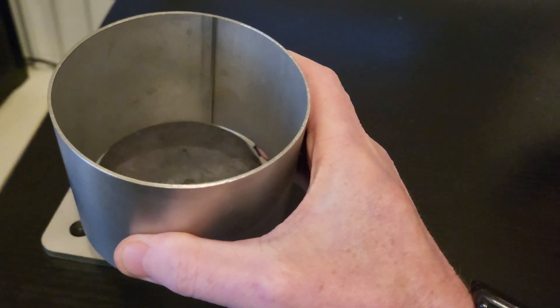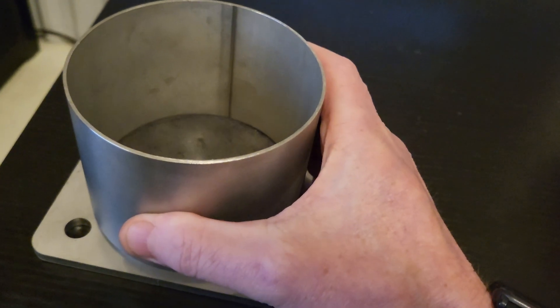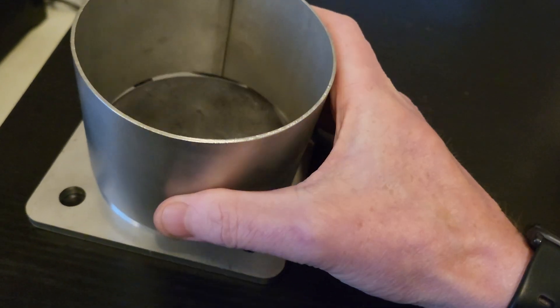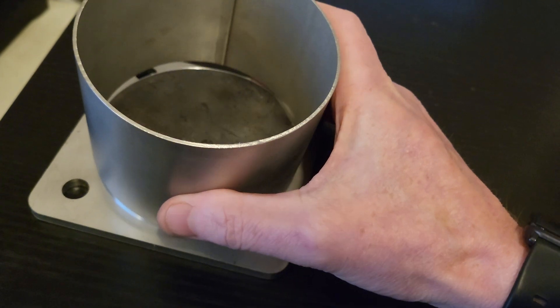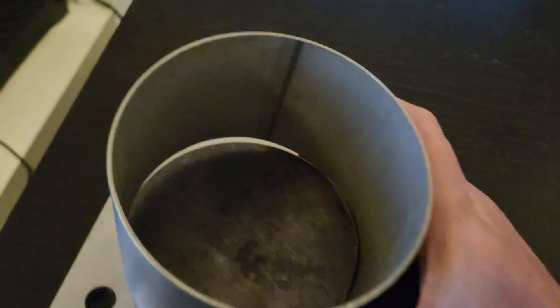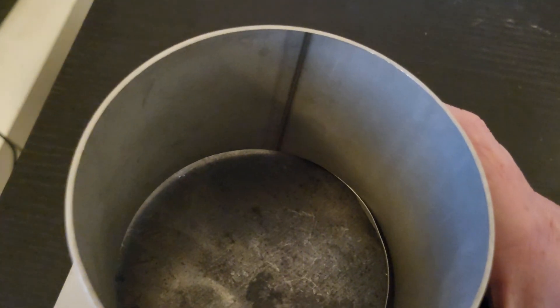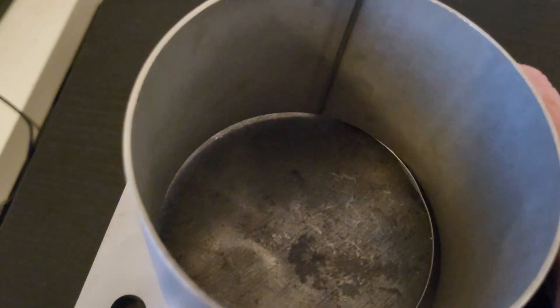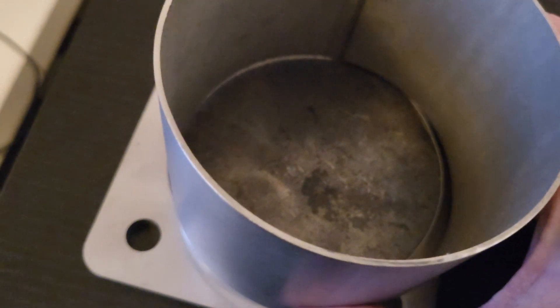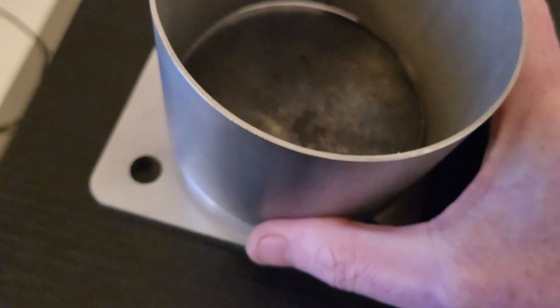And then this, to contain the whole thing, will be placed on top. It's a really tight fit. There's like a 0.75mm gap.